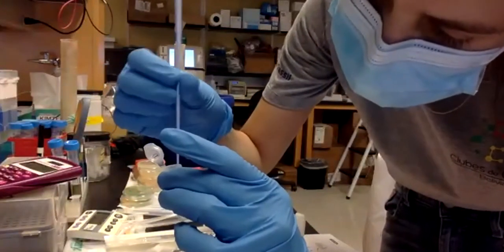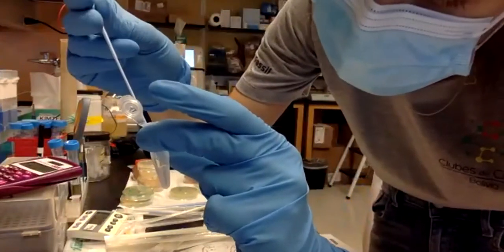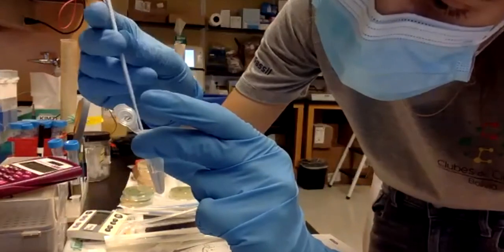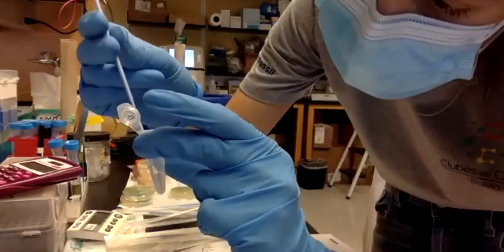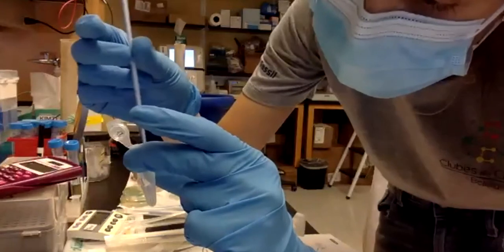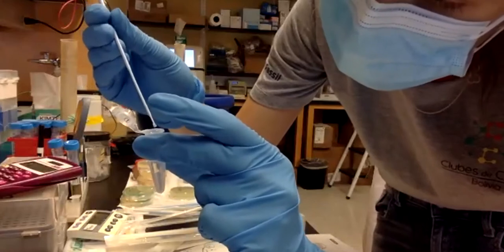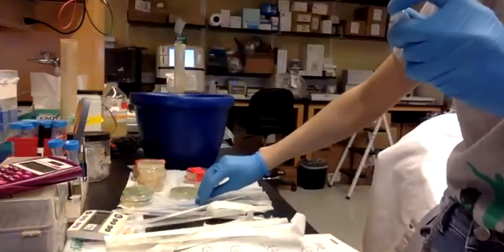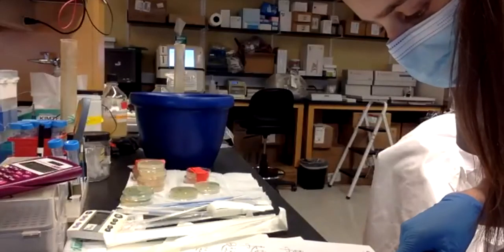Just by doing this, all the bacteria I pick from the plate is going to be transferred to the transformation solution. Okay. And this is how we are going to make the competent bacteria. Sometimes we can buy bacteria that is already competent, so we don't have to do this step. But this is not the case for this kit. Okay, place it on ice. So then it says, repeat step 3, repeat 5, okay.